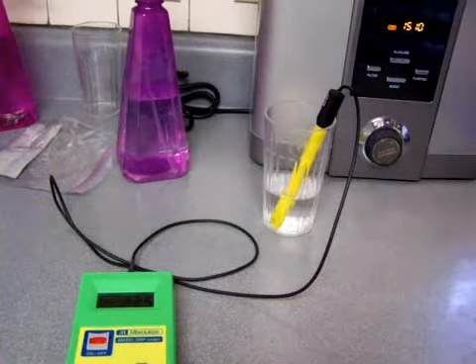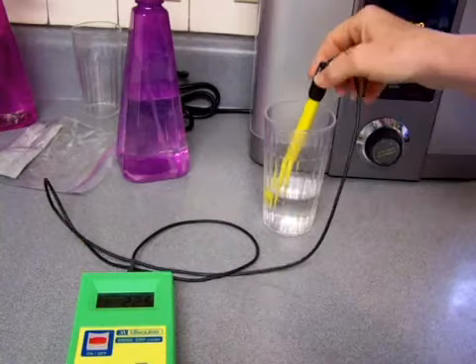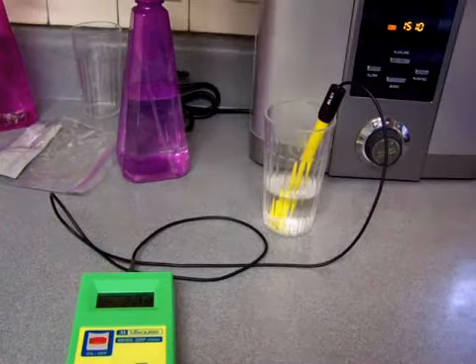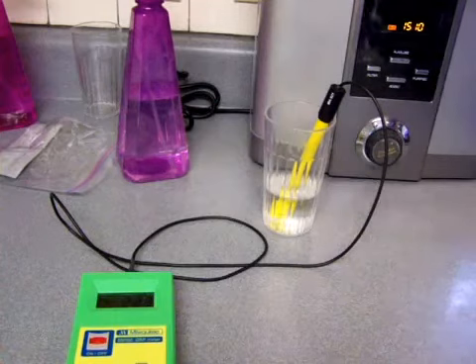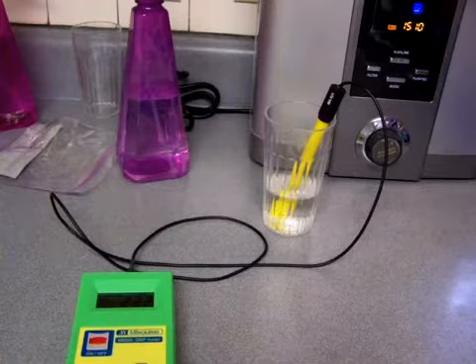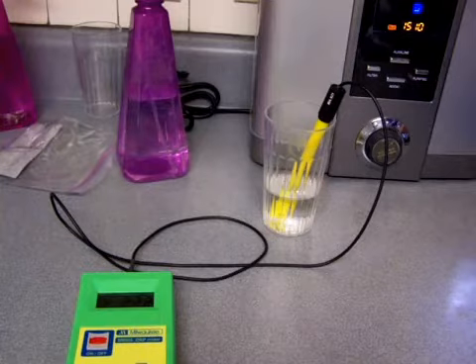I'm continuing a demonstration that I started yesterday, and this probe has been sitting now, actually I let it sit overnight, in the ionized water. And so it's definitely dirty, and I'm going to pour some fresh ionized water here and see what the ORP is, what the meter is measuring this ORP to be.